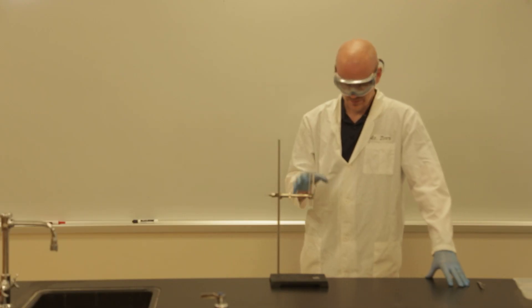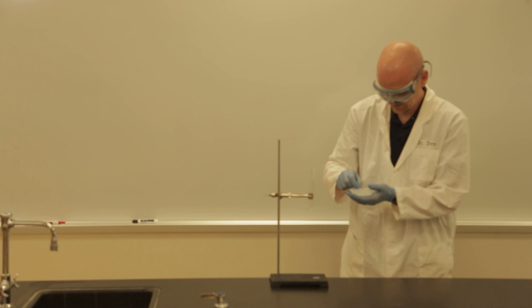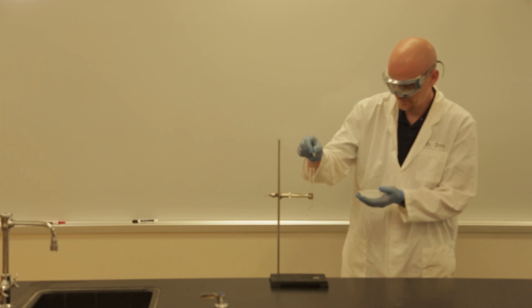So now we're going to repeat the process using our copper chloride. So again, small sample goes in the test tube and we're looking for any kind of reaction here. Sample number one.